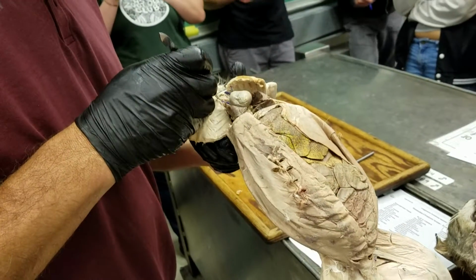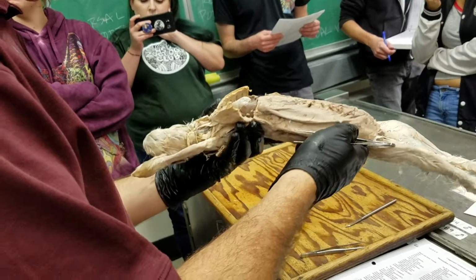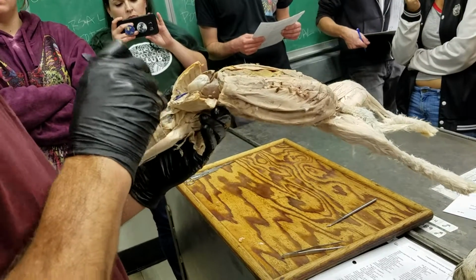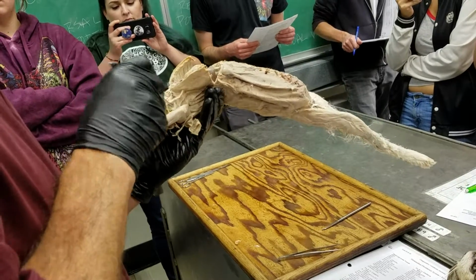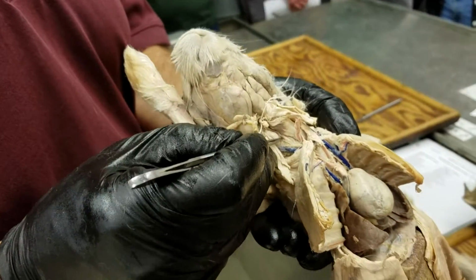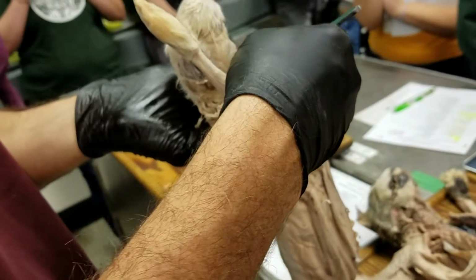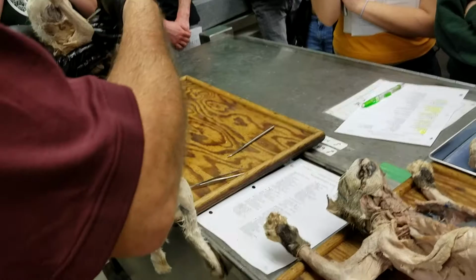Did we see, I'm just trying to remember, Kyle, did you see the internal jugular in here? Oh, no, on the side. Very sliver. On the right side. Is that your right side, or the rabbit's right side? Yeah. The brown little sliver. Brown sliver on the right side. Oh yeah, there we go. There's the internal jugular, right there, this little thing running along. And what you'll look for with the internal jugular is a small vessel running right alongside of the common carotid artery.